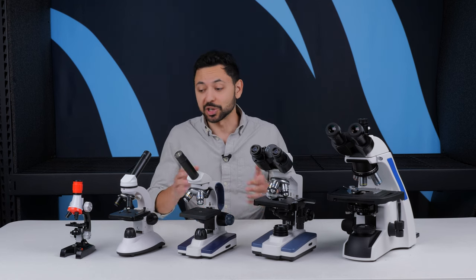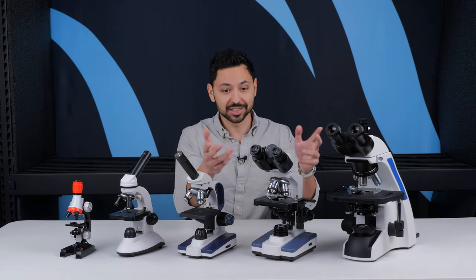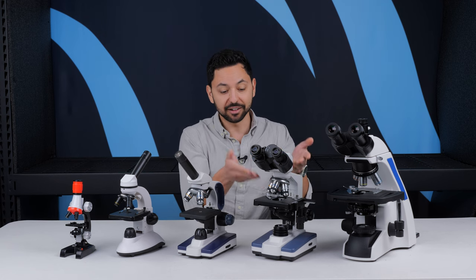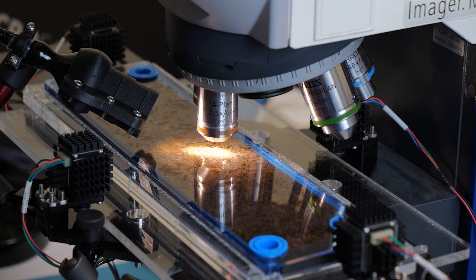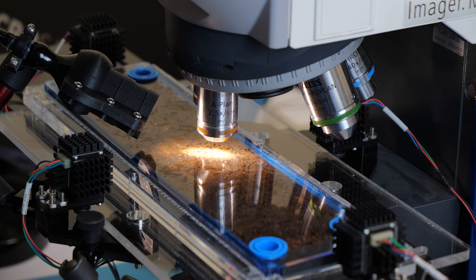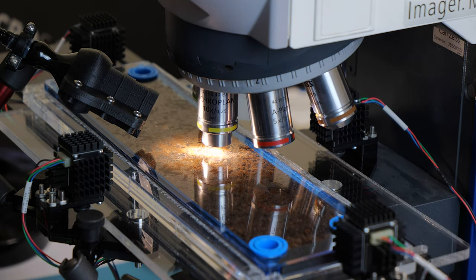What is a compound microscope? I have a bunch of compound microscopes here, and the key word is compound. What that means is that you have fixed magnification objectives on it. So if you want to change the magnification, you have to rotate down a new objective onto the sample.